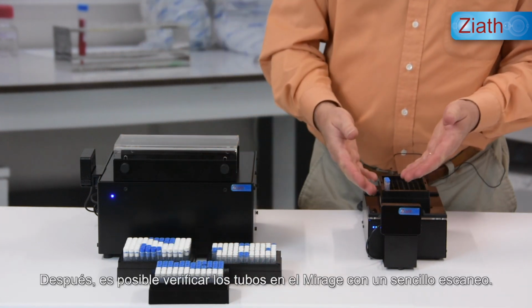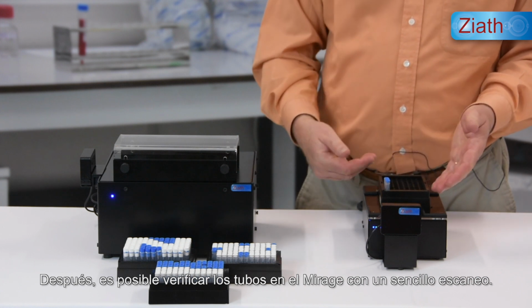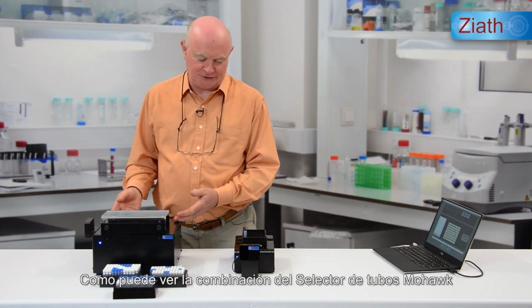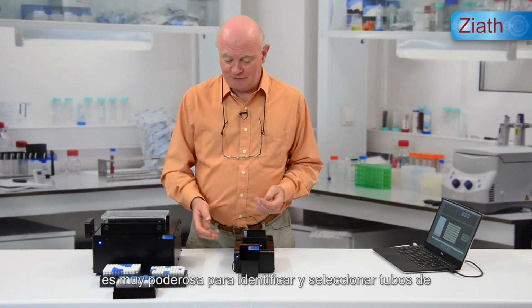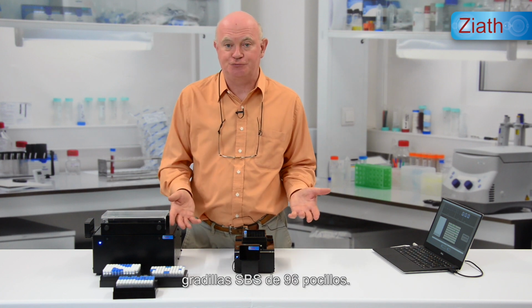As before, the tubes can then be verified on the Mirage with a simple scan. So as you can see, the combination of the Mohawk tube selector and either Mirage, Express or Cube 2D rack scanners is a very powerful combination for identifying and selecting tubes from 96 well SBS racks.